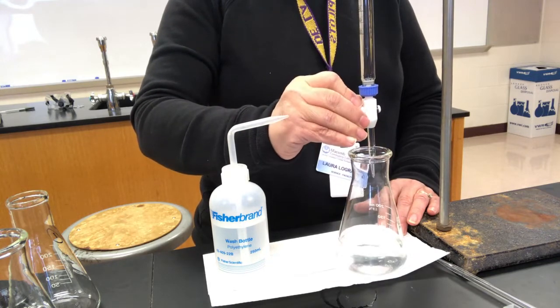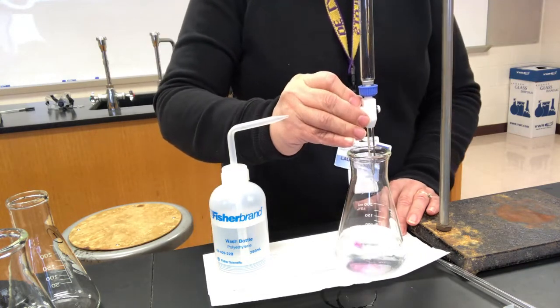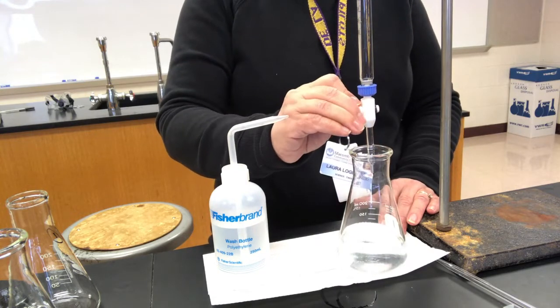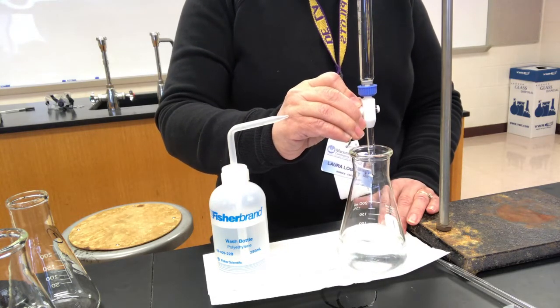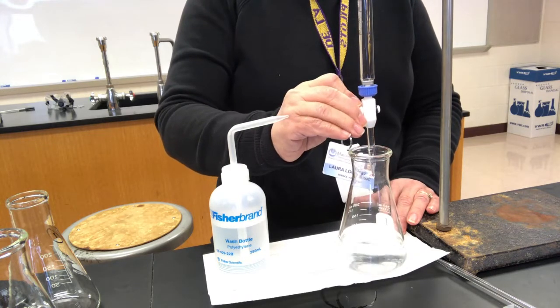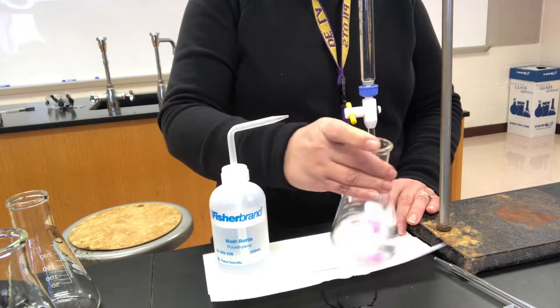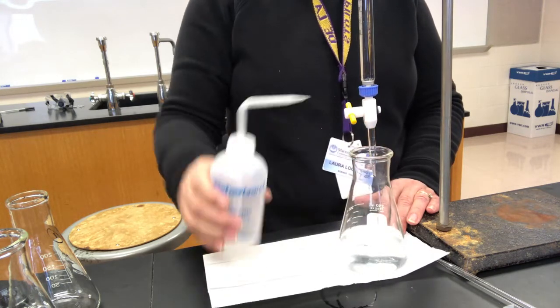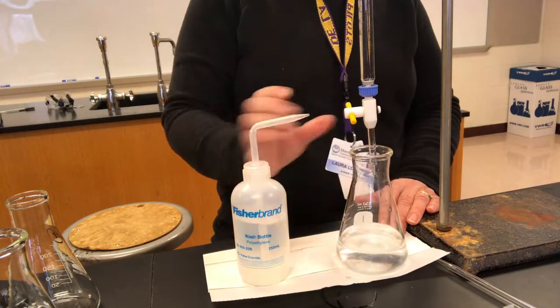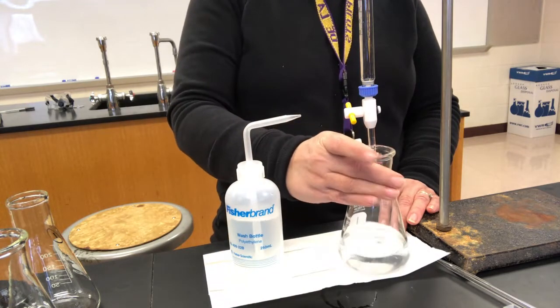Okay, it's still going away pretty easily. Ooh, that's lingering a little bit more. Ooh, that lingered a little bit. So now maybe I'm going to start adding just 1 or 2 drops at a time, since it's lingering a bit more. Sometimes if the drop is just hanging off the tip and not falling in, I'll even squirt it off with the wash bottle. Sometimes that's enough to get it to change. See how squirting that little hanging drop with the wash bottle made it blush a little bit?